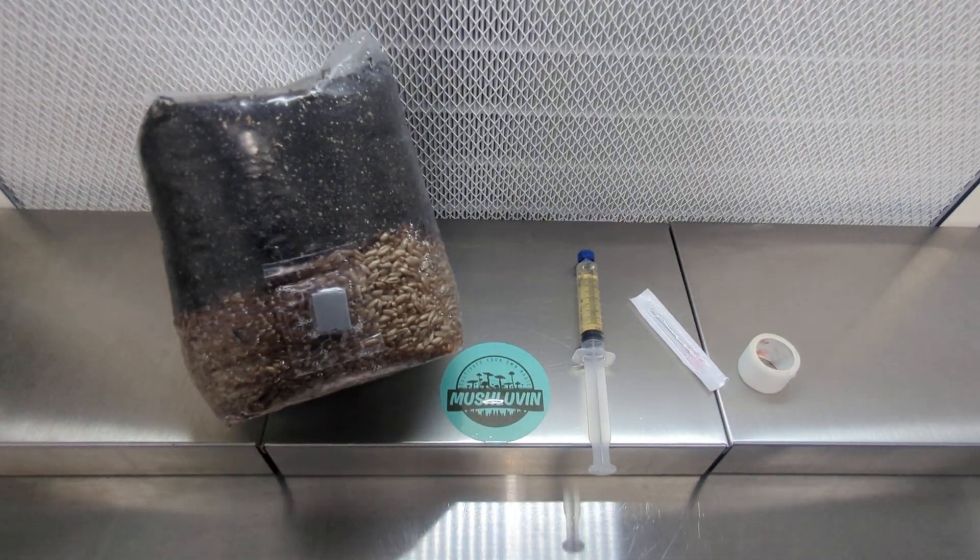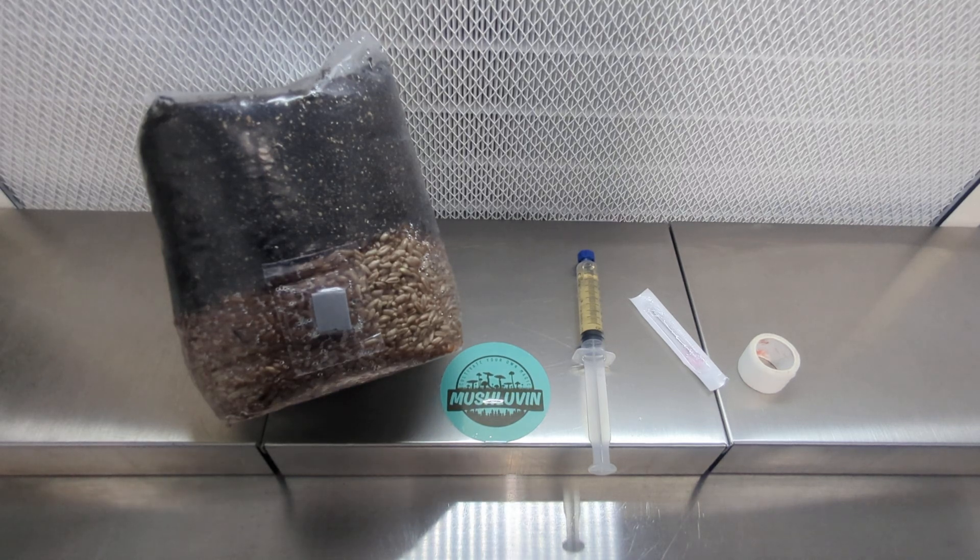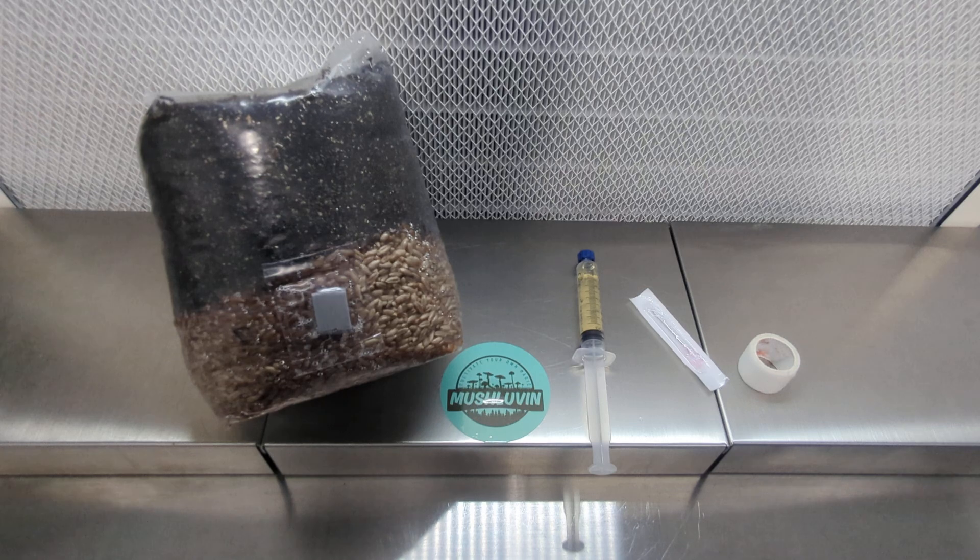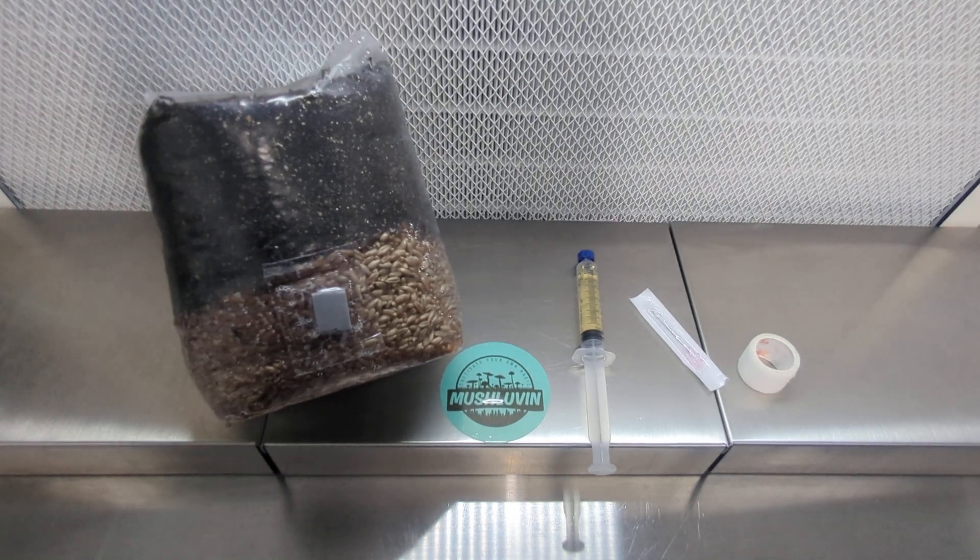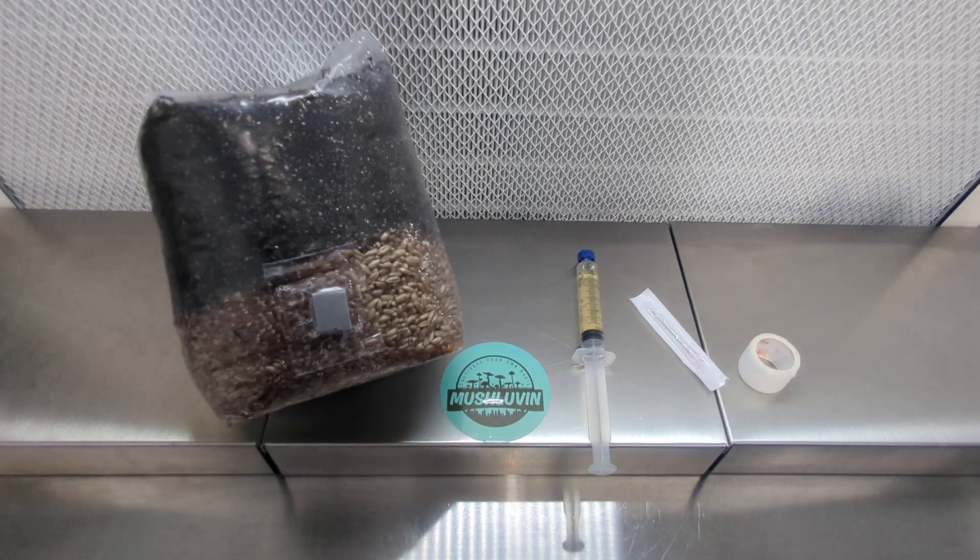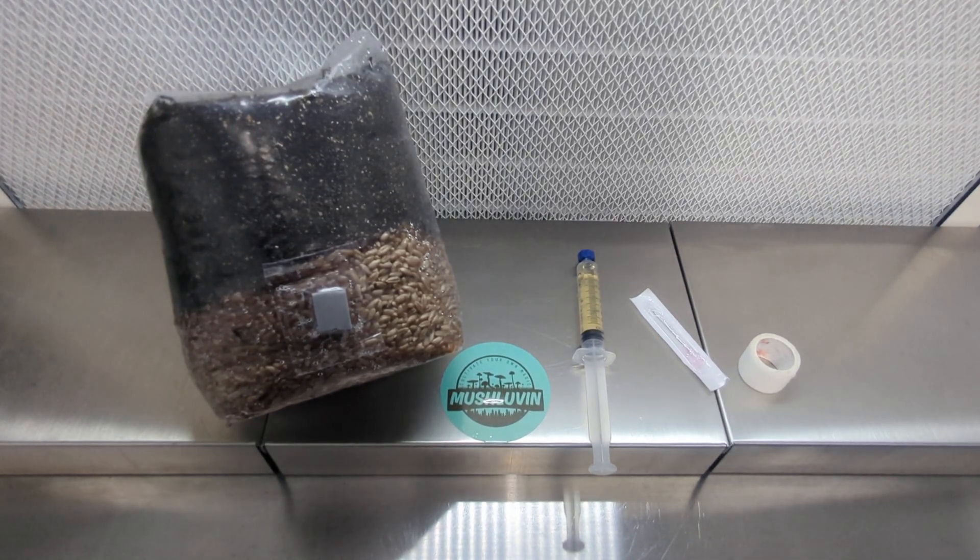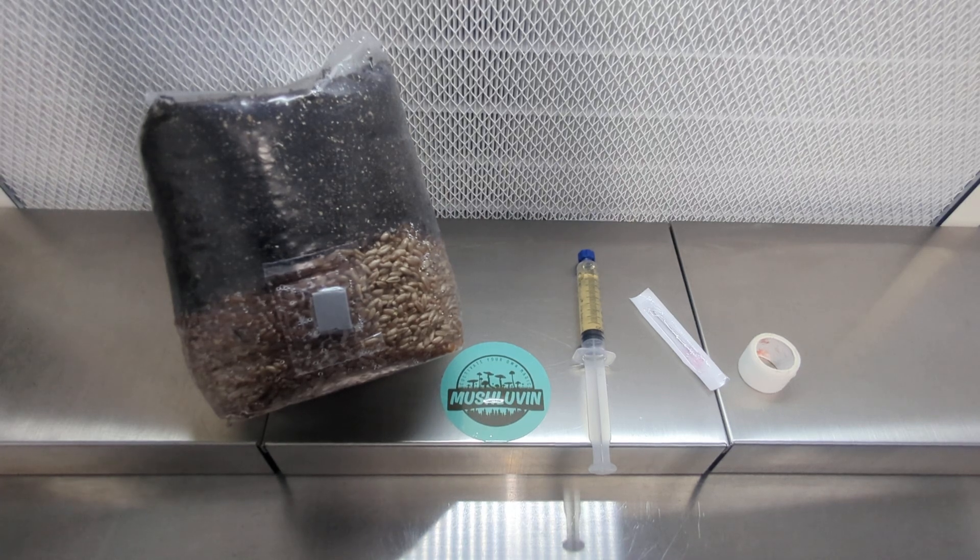As usual I've turned off the central AC and any fans that would affect the air in the room that I'm working in. You don't want any mold spores or bacteria floating around, so you give that time to settle down. I'm going to work in front of a flow hood today which I've also let run for 30 minutes to clean the room as much as possible.